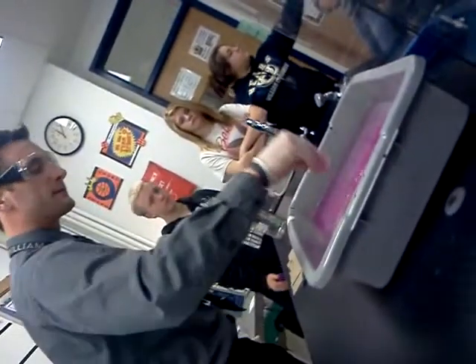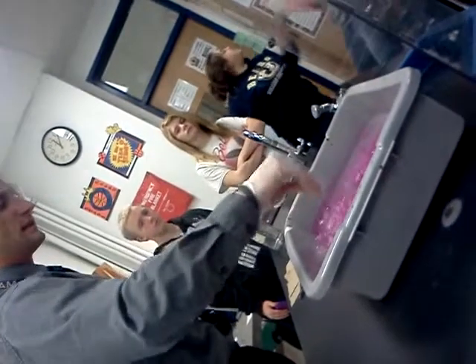I'm going to throw the water back here. We'll see if it produces the base again, if it turns the water pink. And hopefully the sodium will ignite for us. Hopefully. Cross my fingers. Water. If it doesn't, we have to do something else, then lithium or potassium.